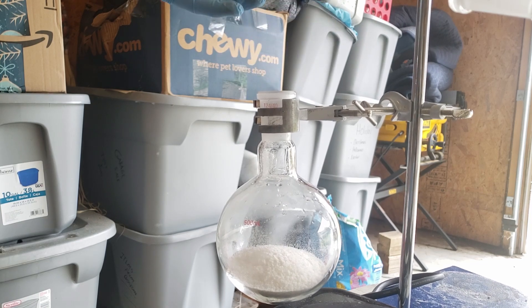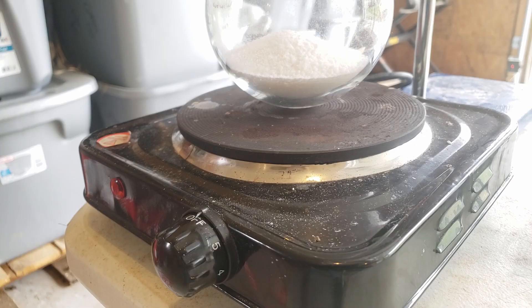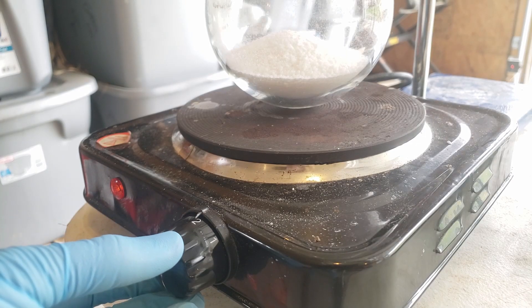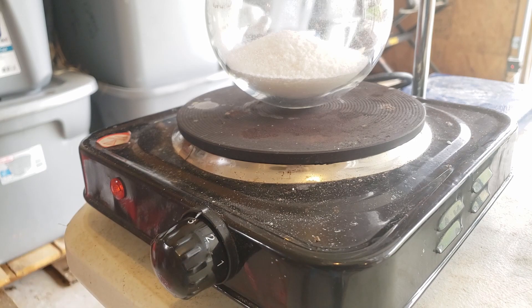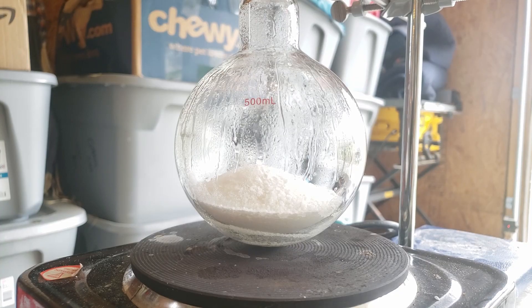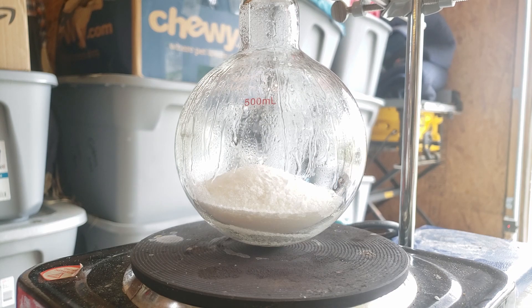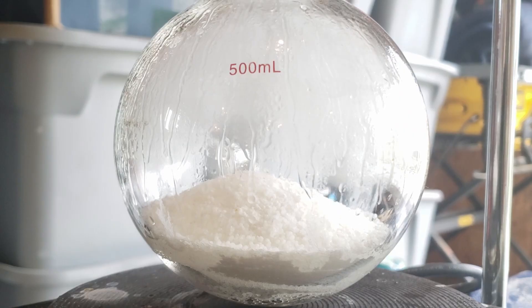I then set up for basic, simple distillation. I began heating, and not too long after, the sodium bisulfate began to melt. As it began to melt, you can clearly see some acetic acid vapors form as this thick white cloud.